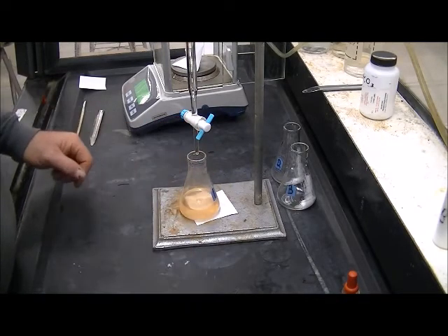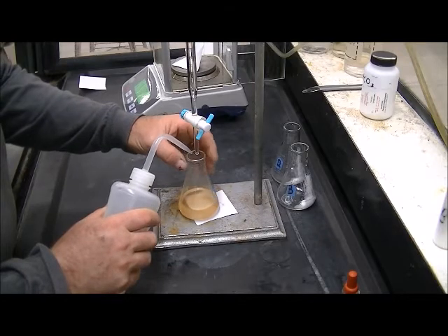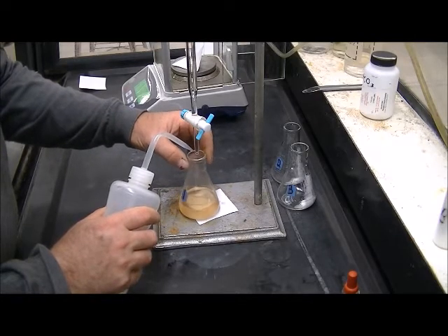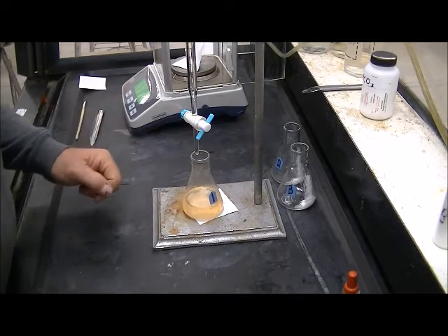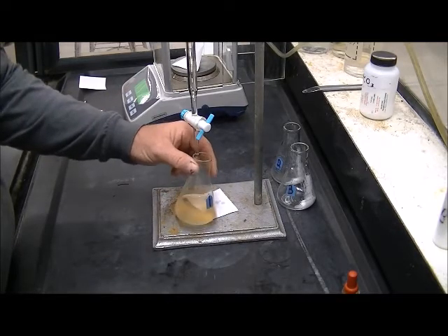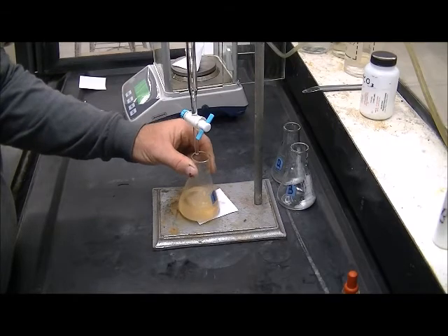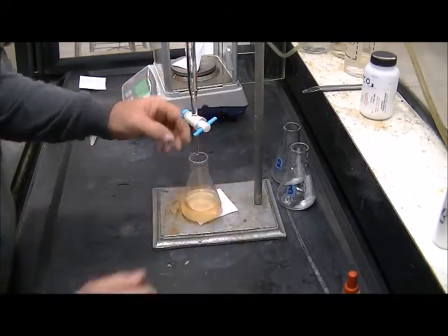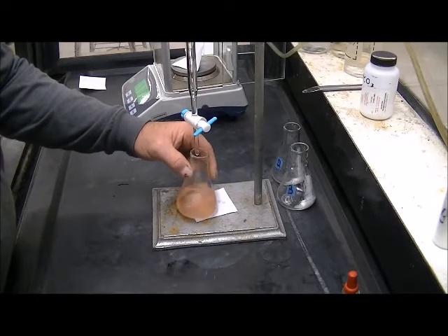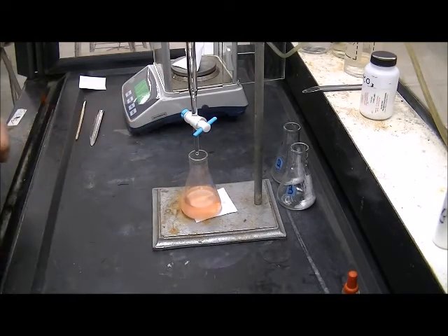We're getting close. In fact that might be an end point there. Get everything washed down in there. It is just looking like it wants to go. Just the quickest drop I can. That is the end point right there.